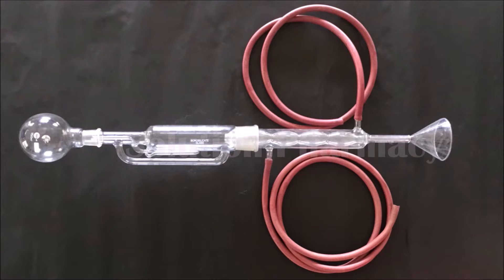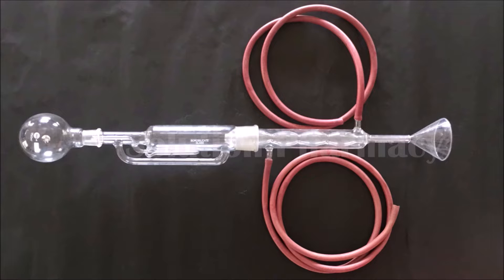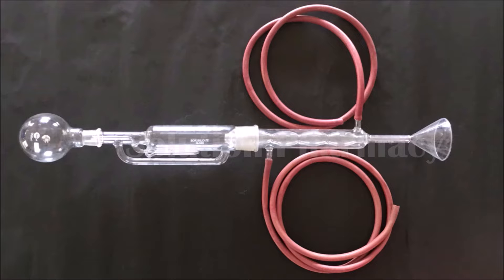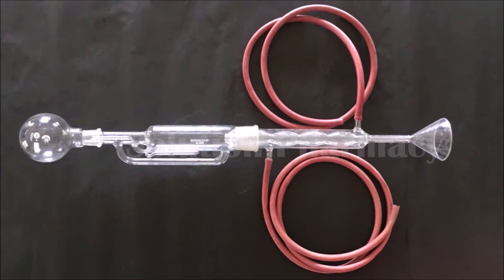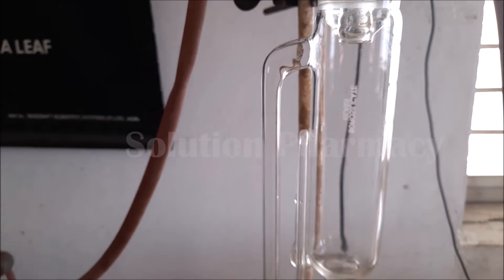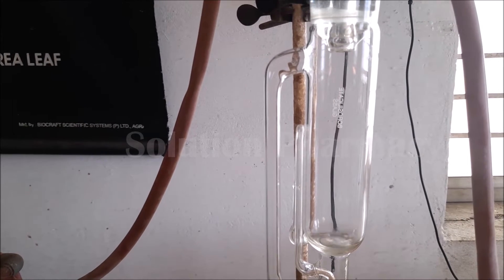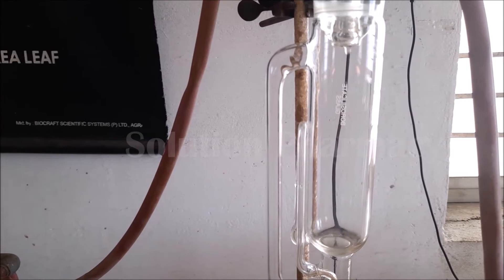Hello friends, welcome to the channel Solution. Today in this video we will show you how we can recover solvent from the liquid extract obtained after the Soxhlet extraction of any crude drug — this is the second part of Soxhlet extraction, that is the solvent recovery method. After recovering solvent from the extract, the extract becomes concentrated.